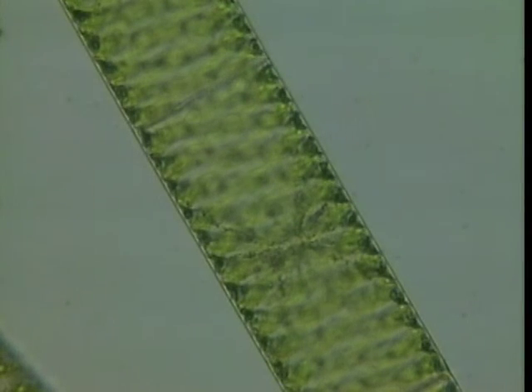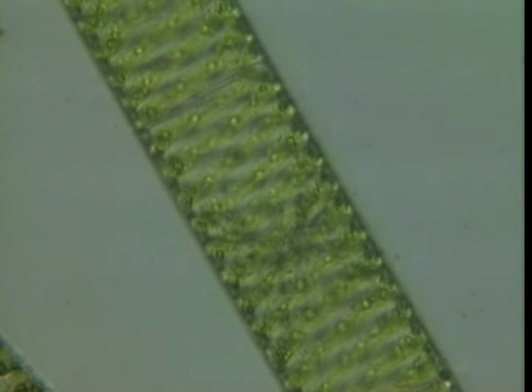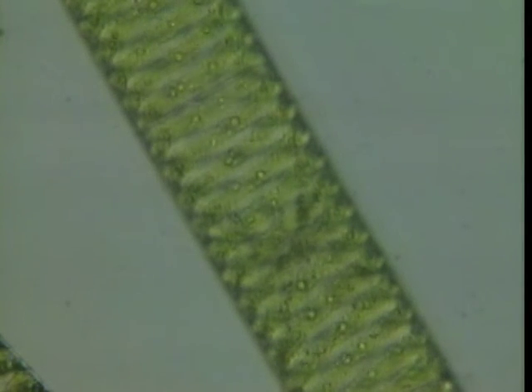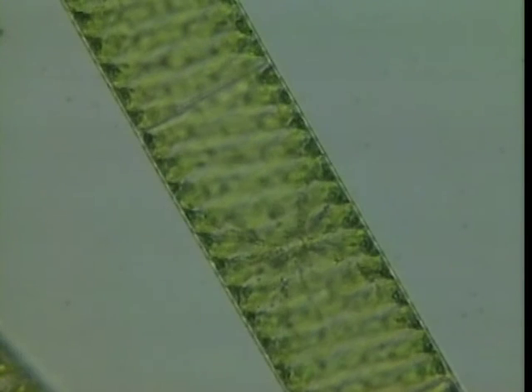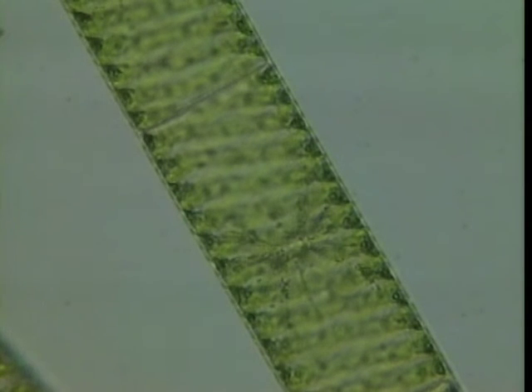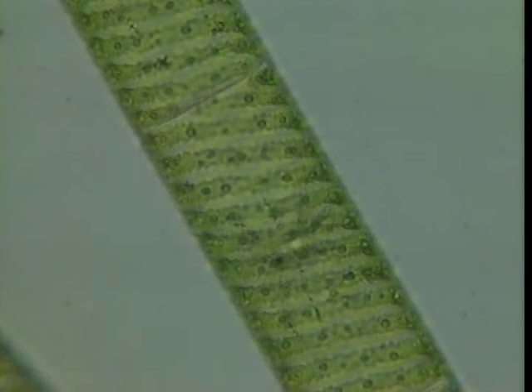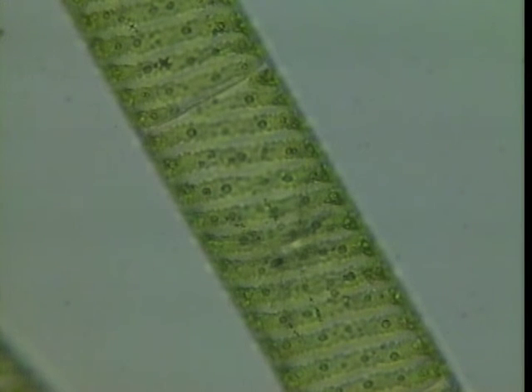See it there? That's the part of the plant that divides and controls the plant. You can see the cell walls too — certainly the cell wall on the outside, but you see there's a line up above. See that line up there? That's the edge of the cell.